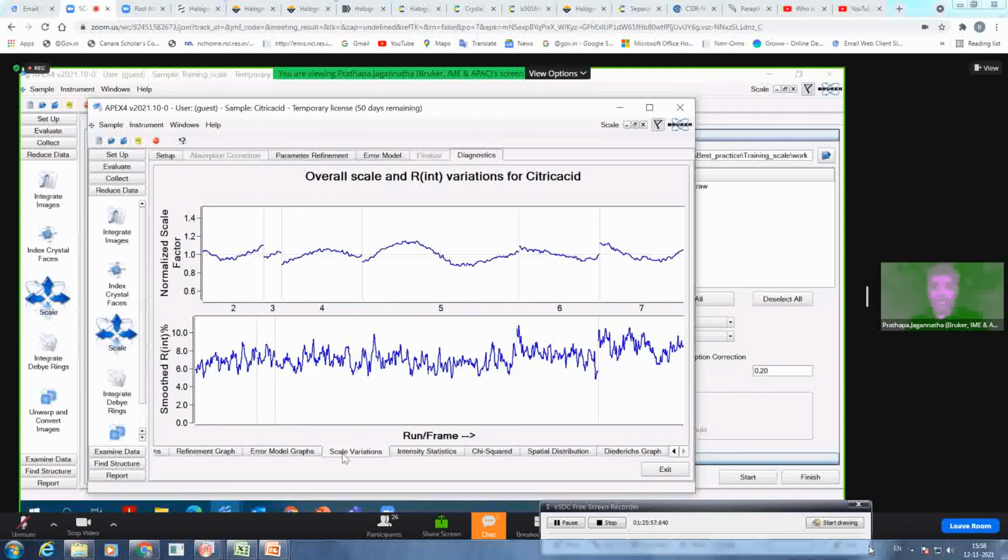And then to look at the scale variation, ideally the normalized scale factor should be falling on 1 for each run. So then the crystal is a particular shape and it's isotropic. If there is an anisotropic crystal like a plate or needle, where one length is longer than another, then you might see a sinusoidal variation. But if it is too much different in two directions, then you see a longer variation that will be reflected in your R internal as well.